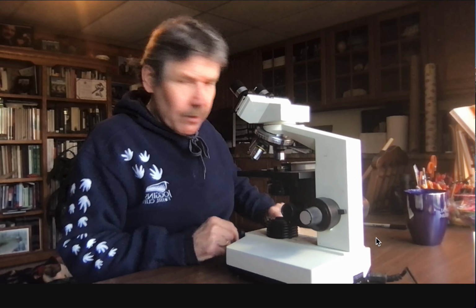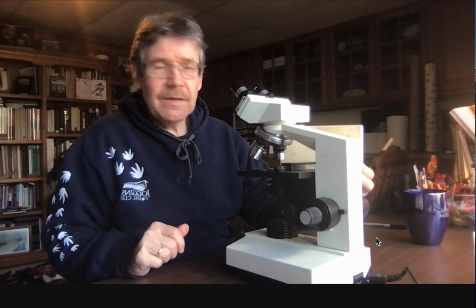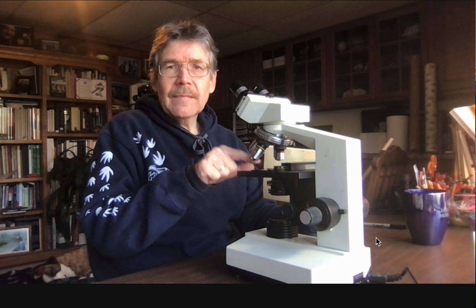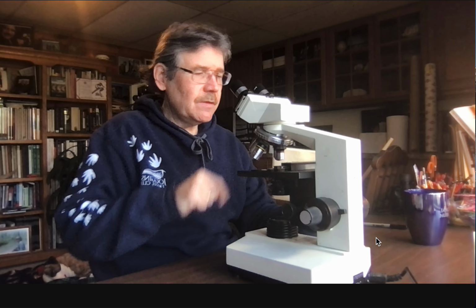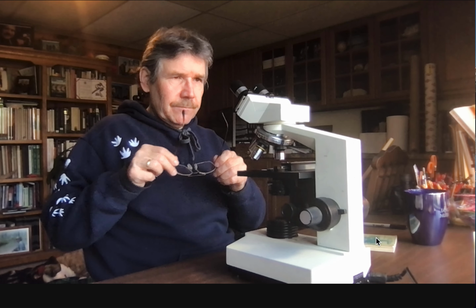And you can see that working distance. I think you can see it. Let me get my glasses back on. And you can see the distance here between pretty much the slide down here and the tip of the objective right there. All right. Other things to think about.